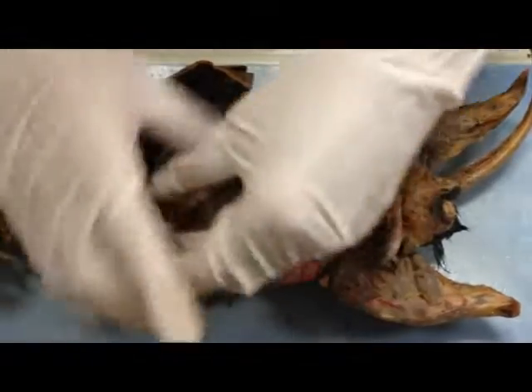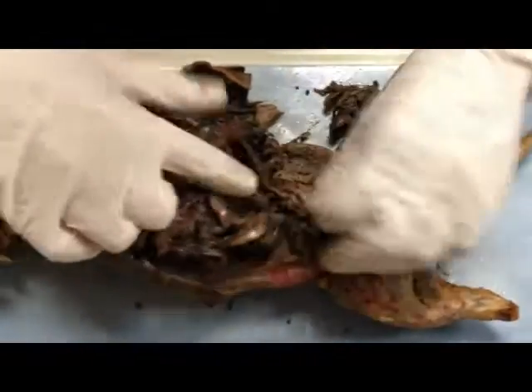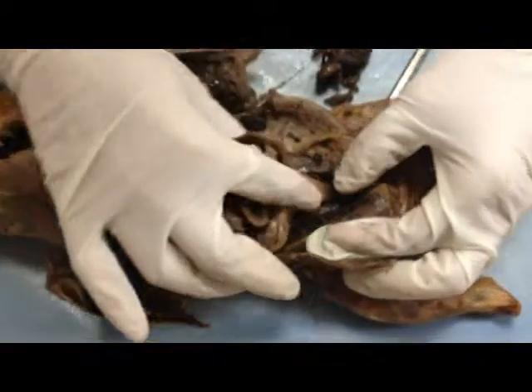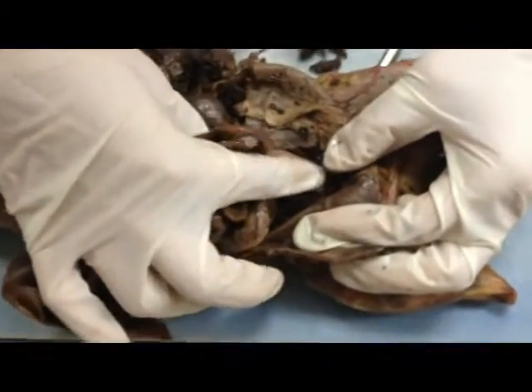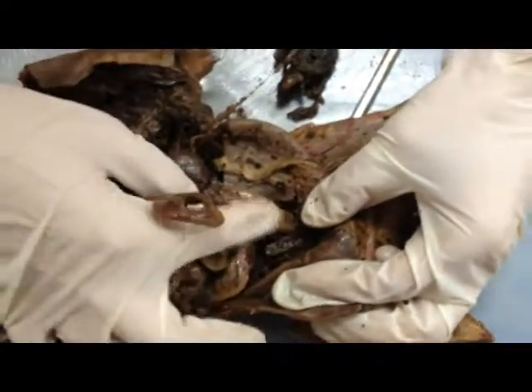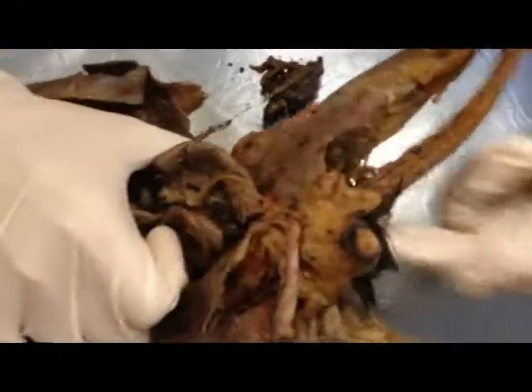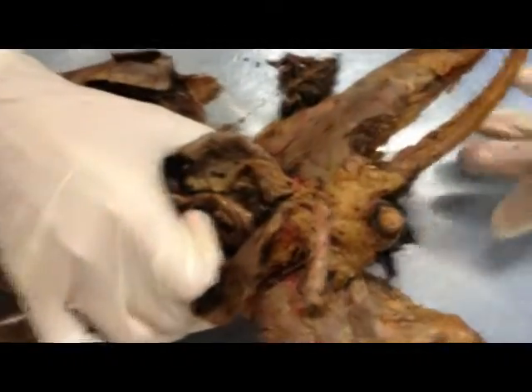You have the rectum — the rectum would be this portion right here before it exits. And then the exit on the other side, of course, is going to be the anus.